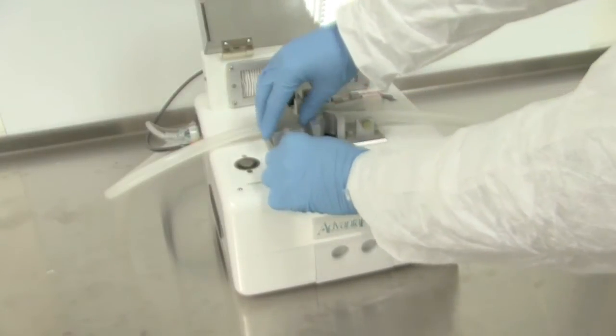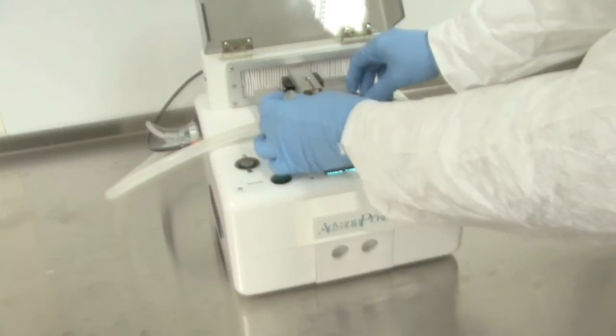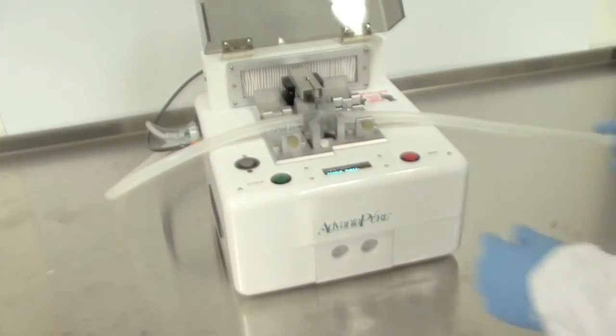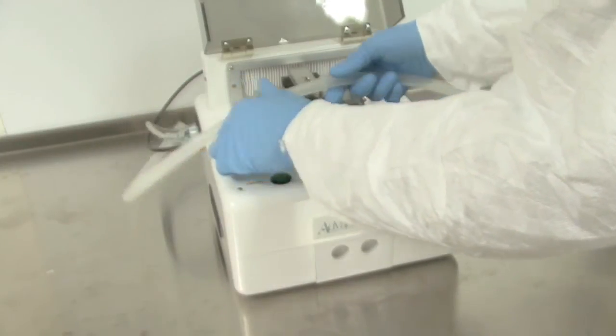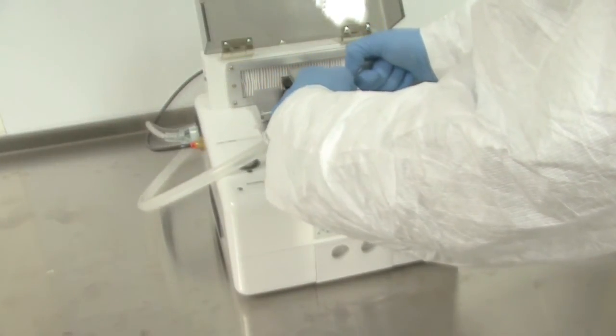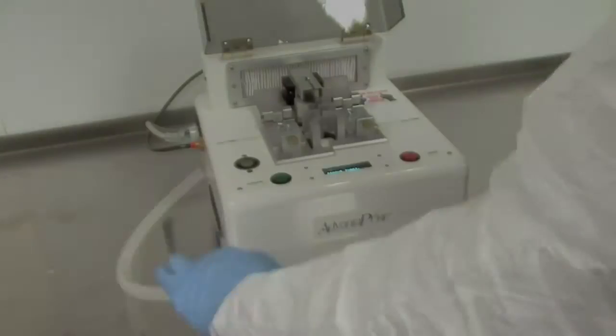After the lid is opened and clamps are released, any waste material is removed. The technician removes the welded tubing. To break the thin seal formed internally during the welding process, the weld point is pressed. The connection between the two tubes is now open.